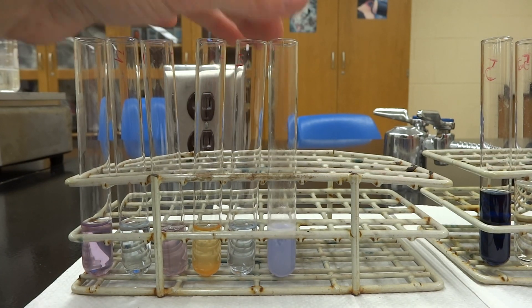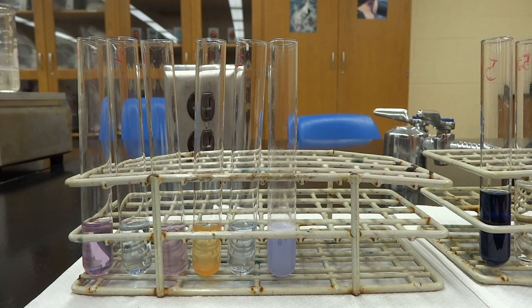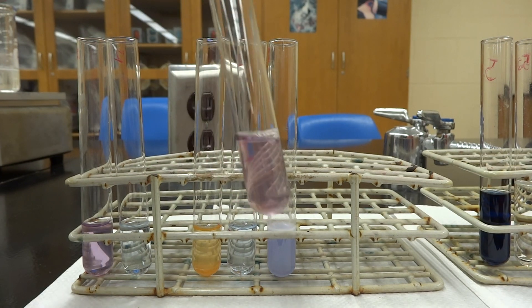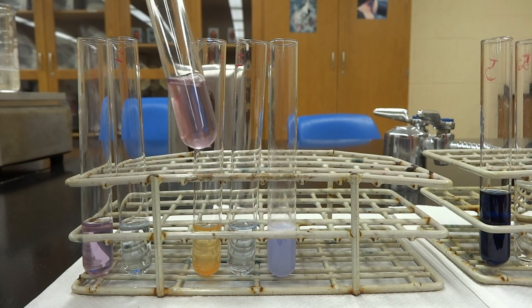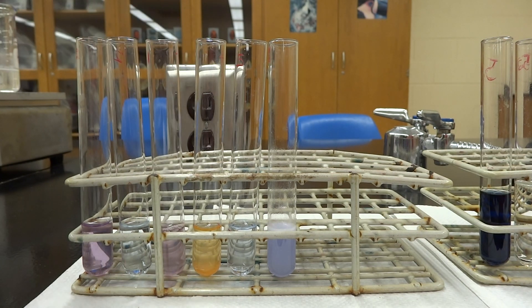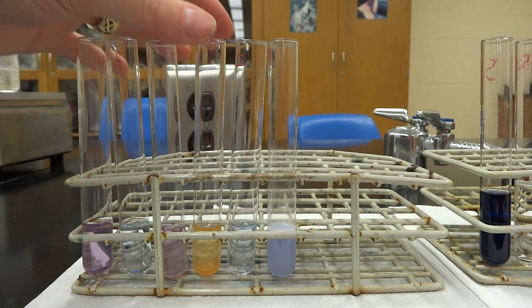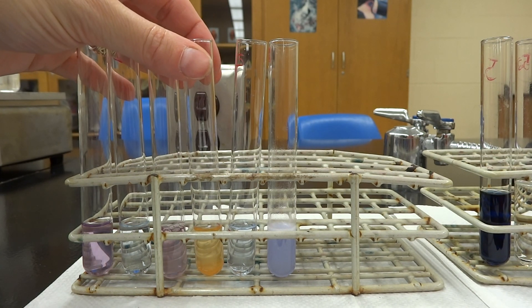Taking these and comparing them to our positive and negative controls, we can see that the egg albumin has protein in it. Albumin is actually protein, so it's going to react with the biuret test. Egg whites are what you put in your protein shakes if you really want to.